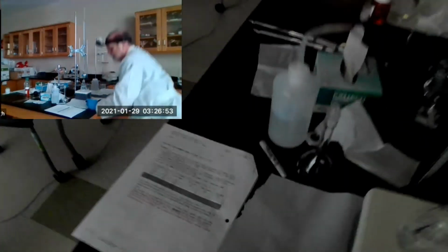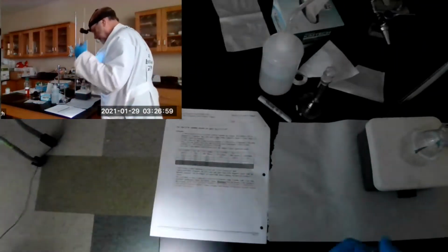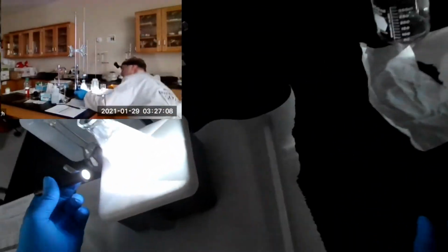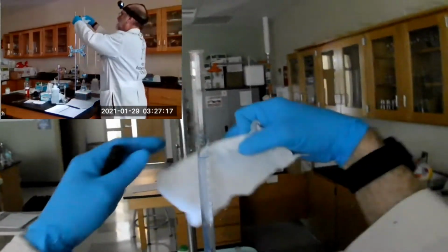Okay, so let's read this volume and we'll just record it. I mean, we went to the trouble, we might as well write it down. So how much did we add? Yeah, it's still there. How much did we add? Let me put a white sheet behind.